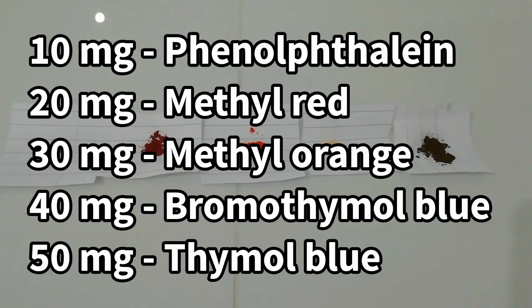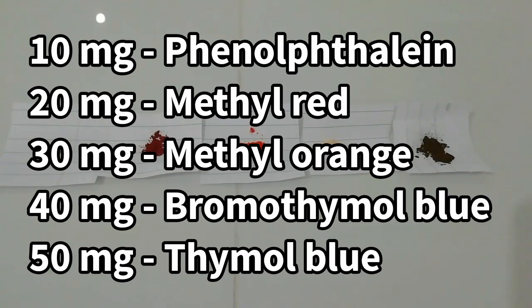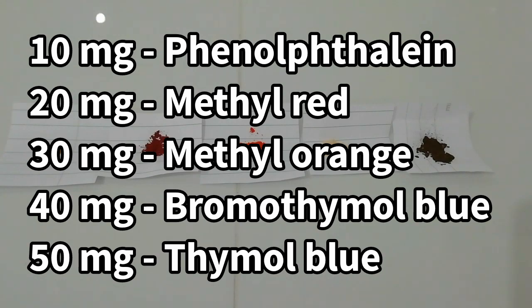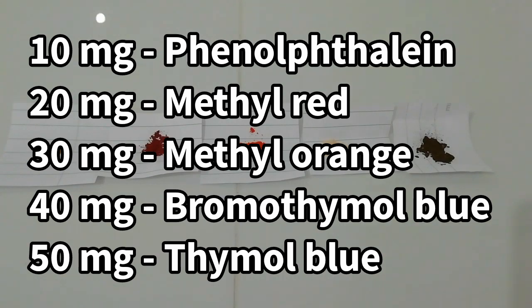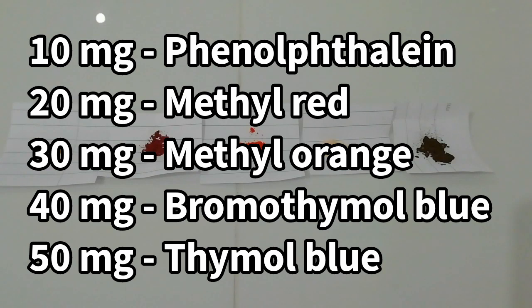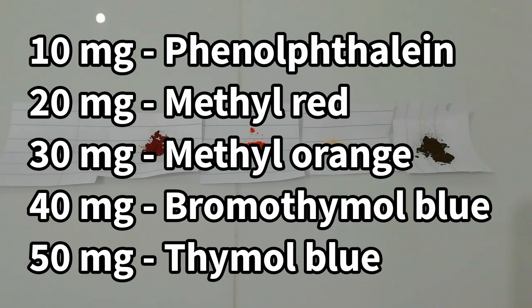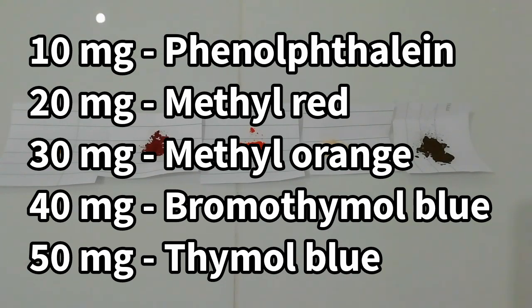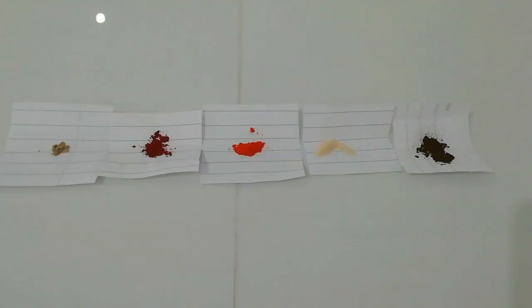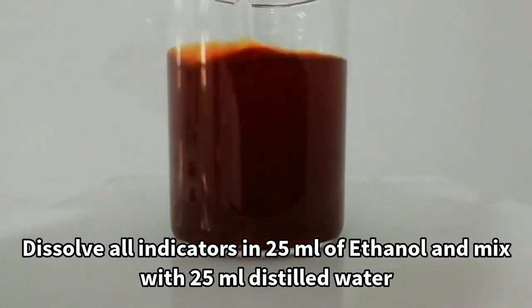For the experiment we need 10 mg of phenolphthalein, 20 mg of methyl red, 30 mg of methyl orange, 40 mg of bromothymol blue, and 50 mg of thymol blue. These chemicals are indicators.